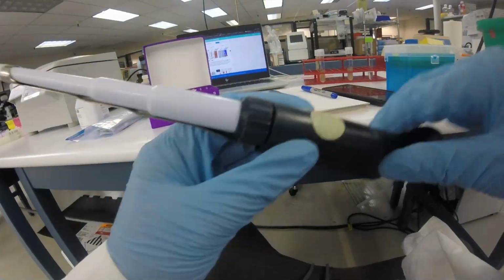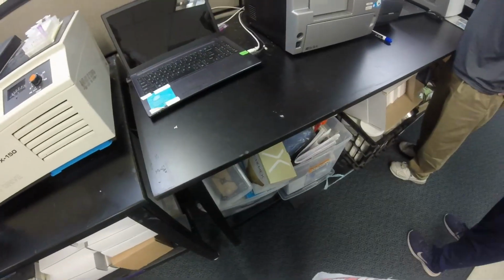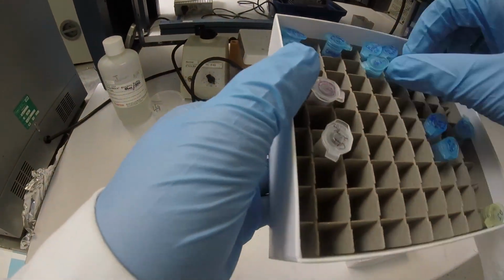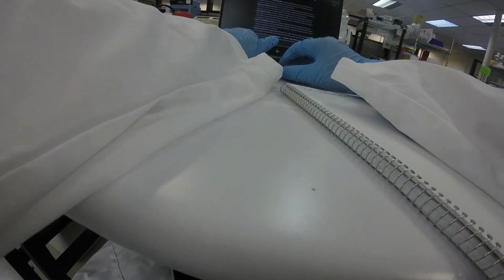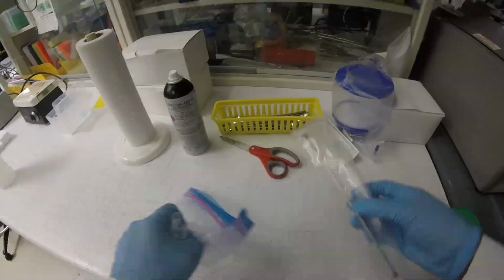Because today, if I want to redo this experiment, I put some of the LB that I think is contaminated into the 37, and today I'm going to check if it's contaminated because I saw these floaters and some stuff that just did not look right, so I just threw it all away. It seems so wasteful. The other thing is today, I probably won't have time because I have to make the LB, and simultaneously I'm going to make some LB agar because I need some new plates. But that'll take an hour. Then I need to grab a colony and incubate, and that'll take like 3 to 5 hours. Given the data that I have, at 37, it takes like 5 hours to even start getting around mid log.